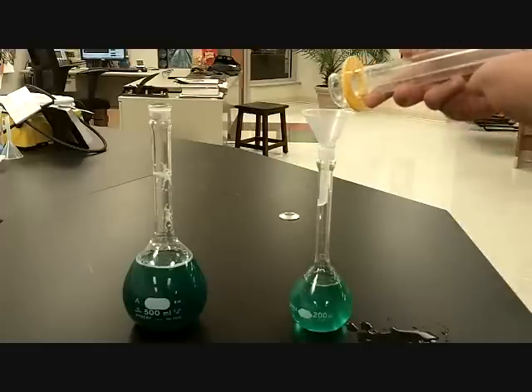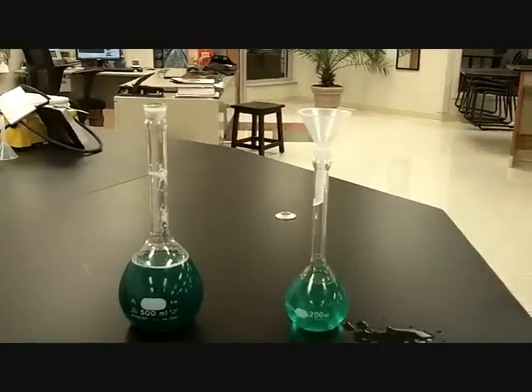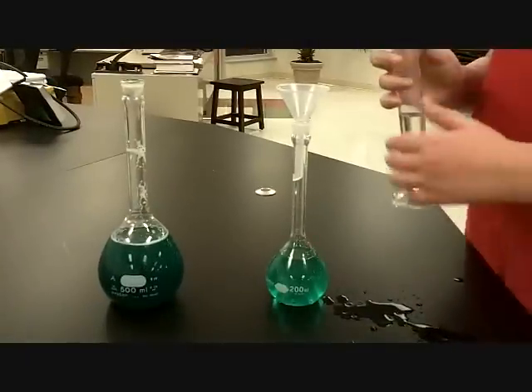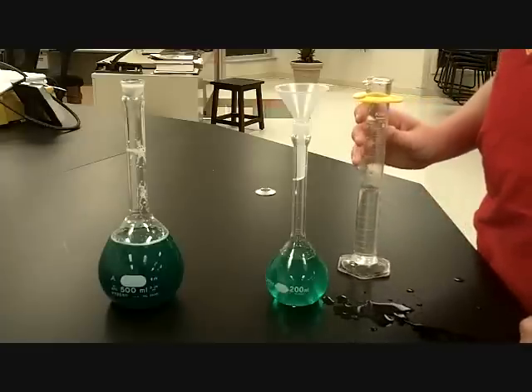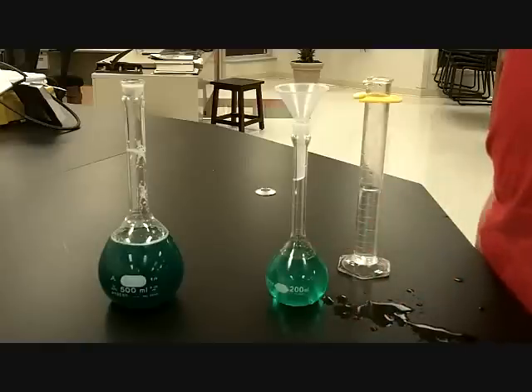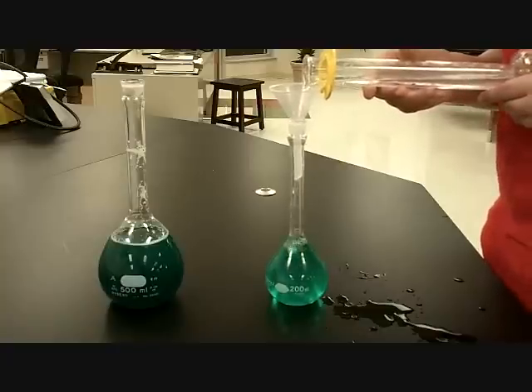All right, probably about another 20 milliliters of water. Now, be very careful at this point that you don't add too much. Add maybe just a little once it gets in the neck. Wait a minute, stop. Can you see where you're pouring and the level of that water as it rises? When it starts getting to the neck, cut it off. Stop pouring. Slowly, slowly. Stop.